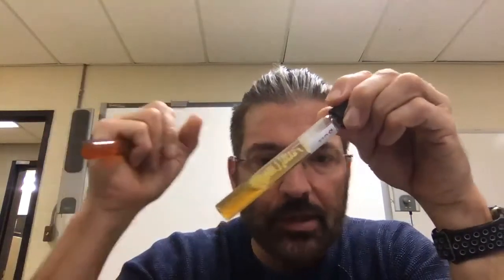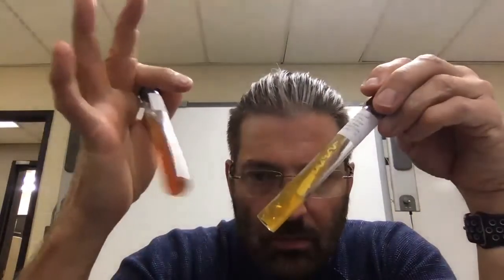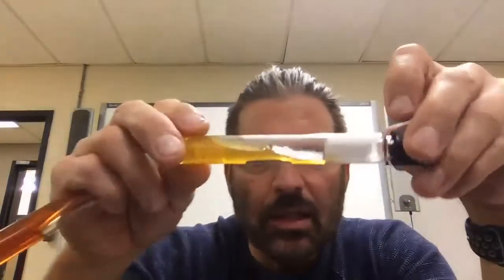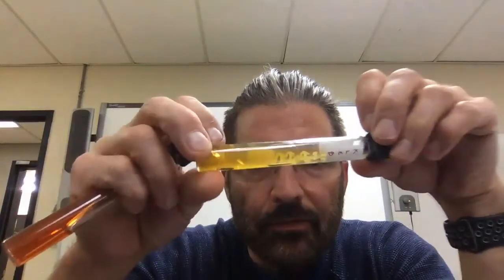Great job, Dr. Bailey. Here is baseline. Here is Klebsiella. Great job, Dr. Bailey. Nice, beautiful, perfectly done.